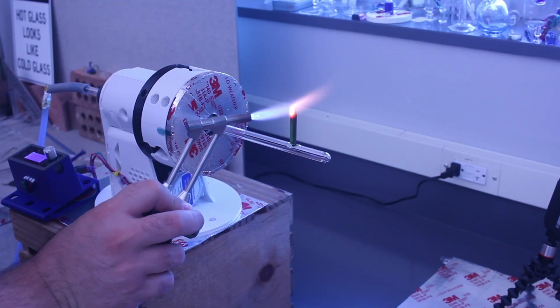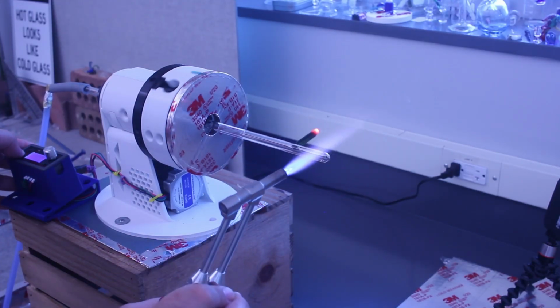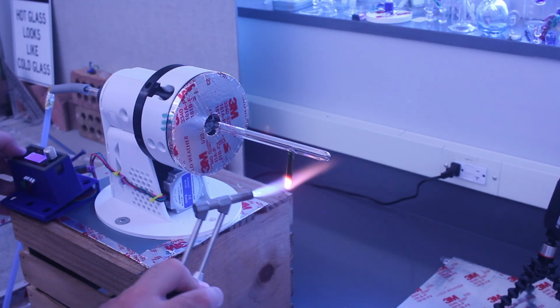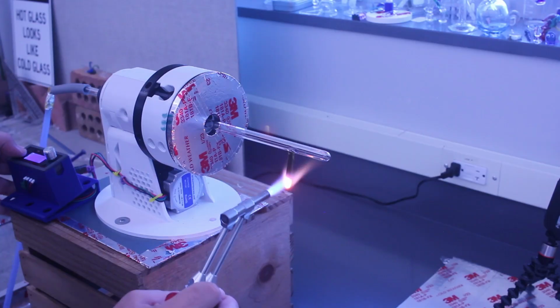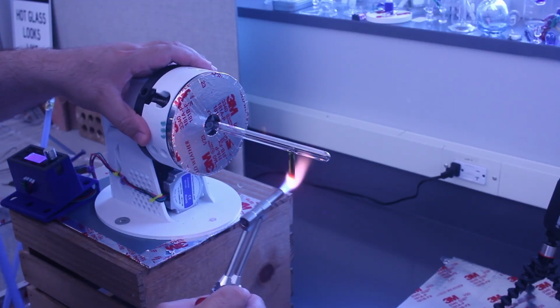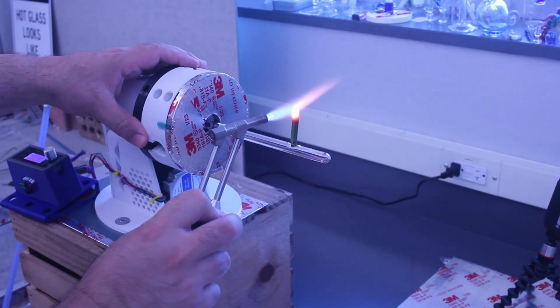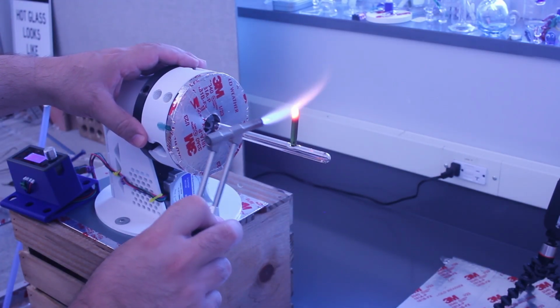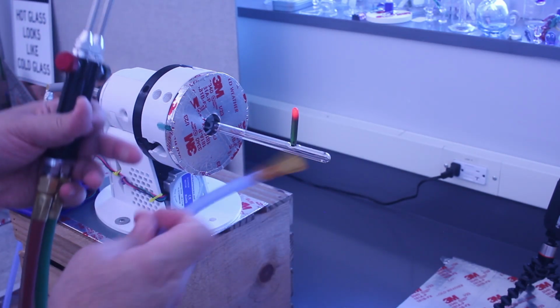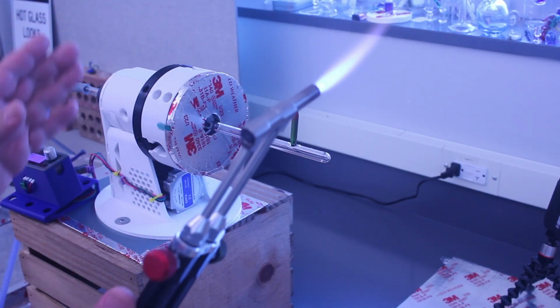And now I'm going to heat this, essentially forming it into a gather to clean it up a little bit. So here, gravity is going to help me out. And it's going to pull the glass down. There we go. I can't obviously touch it by hand. But I can use the marver or other equipment to manipulate it. And there you go.